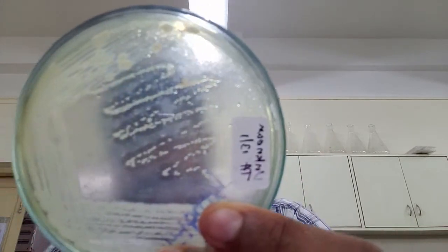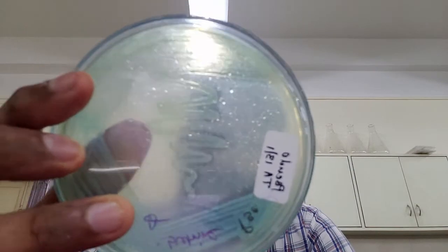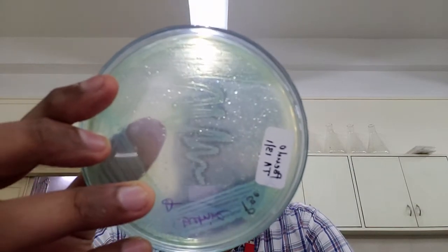These two strains — the unknown strain and Pseudomonas — have given us very good lipase production. This is how you will see a clear zone around colonies on tributyrin agar if it is a lipase producer. I hope this has been helpful, and I look forward to demonstrating more lab experiments. Thank you.